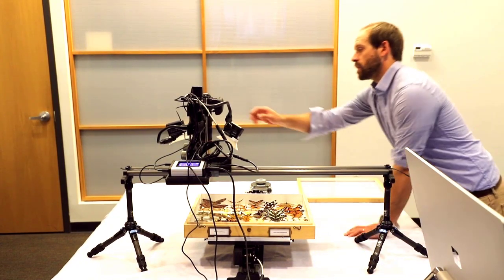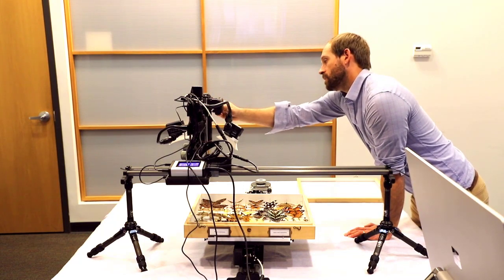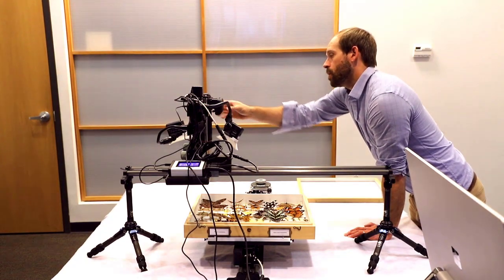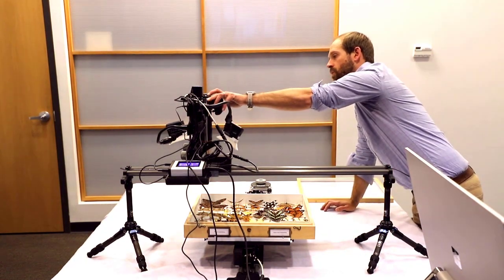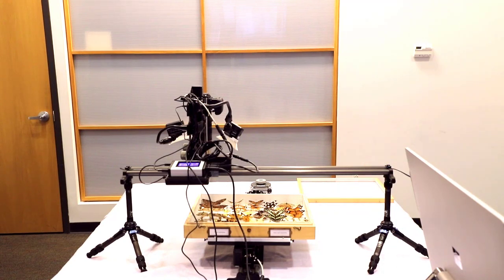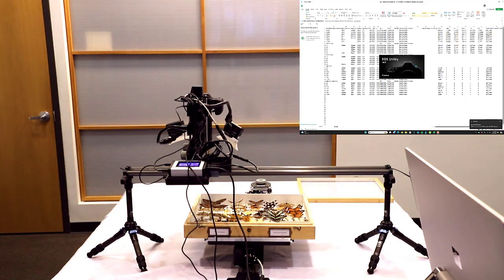So what we can do now is turn our camera on, and we're going to leave it in automatic mode for now. When you power your camera on, it will connect up to the cable, and automatically on your computer it's going to open your camera's live shoot. If it doesn't, you can open EOS Utility on its own, but you can see here mine opened automatically.